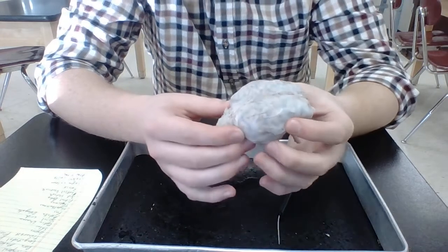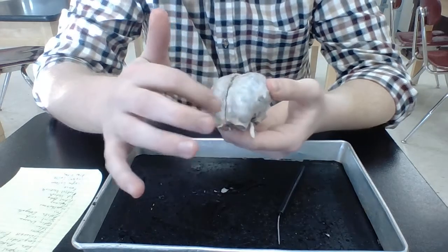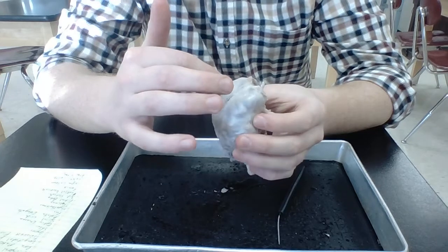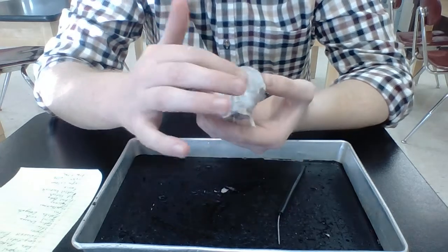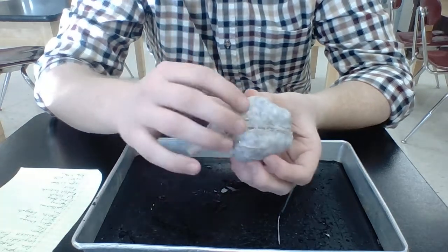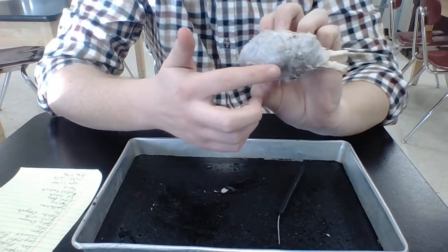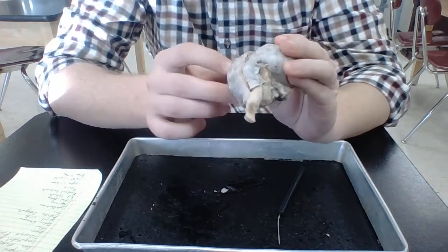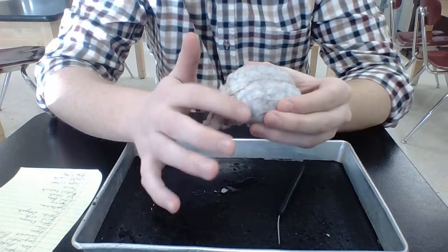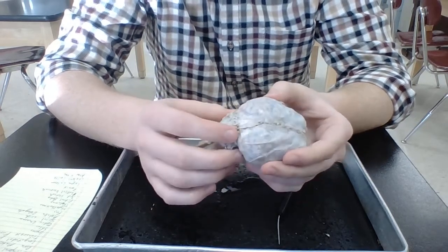All right. So there's a number of different cerebral lobes that you need to know. You have the frontal lobe right here, and this is kind of where the forehead would be. You have the parietal lobe right up top. You have the temporal lobe, so think of your temple, and that's on the sides of the brain, about right here. And then you have your occipital, and that is towards the back where it meets the cerebellum. All right, and these are named actually for the bones of the skull.